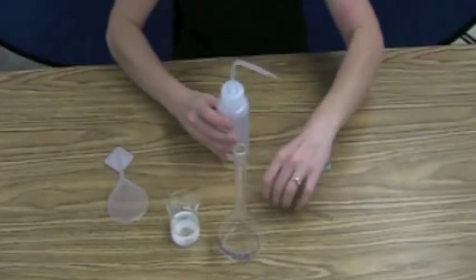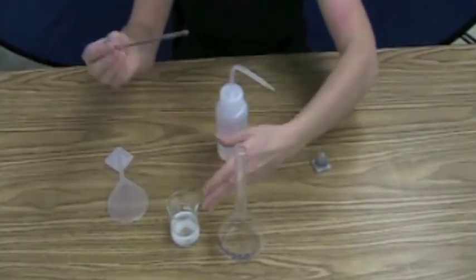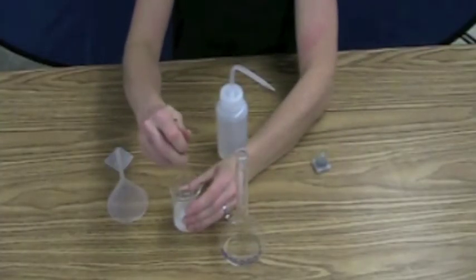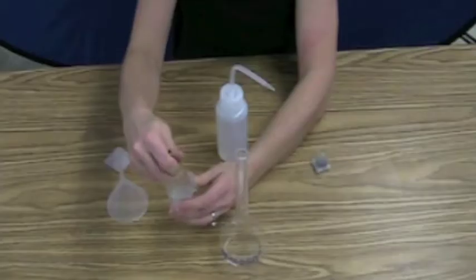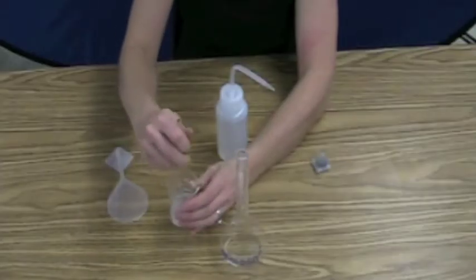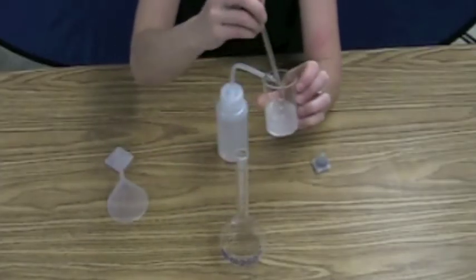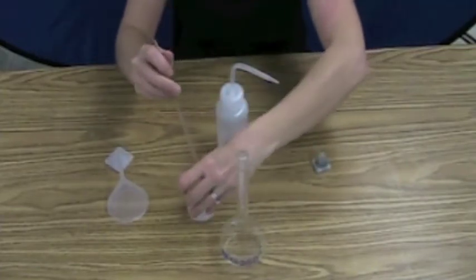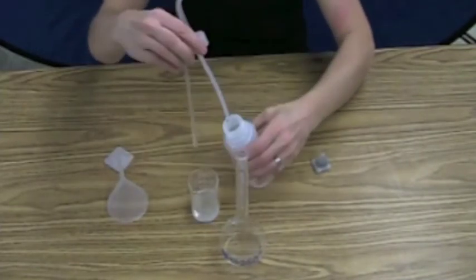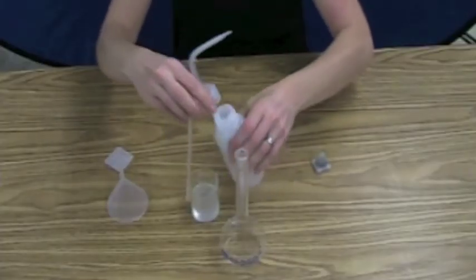So I purposely did this in a small beaker, so I would make sure I would never go over the volume. Now I'm going to speed this up a little bit so you don't just have to watch me stir. So I stirred for a really long time, and I could see that there was still a lot of salt at the bottom, and I still had room to add more solvent, so I'm going to add a little bit more, help it dissolve a little bit faster.